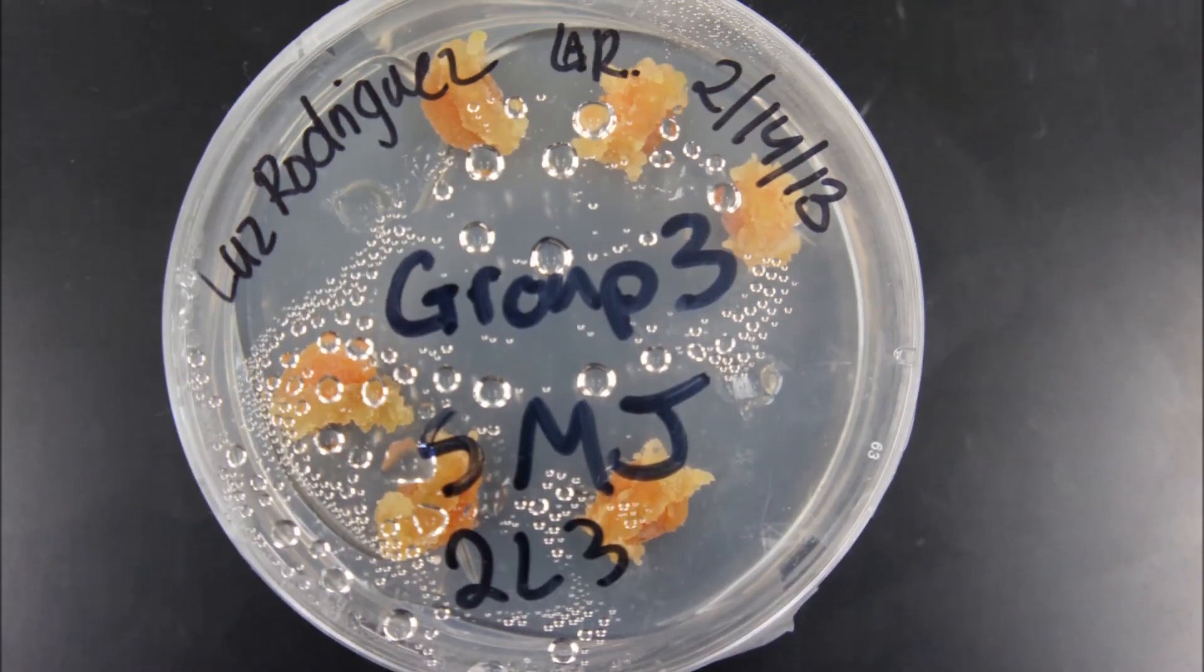Check your dishes in a few days for contamination. If contamination appears, remove the affected dish at once. Do not open the dish. Tape it and discard the dish at once.